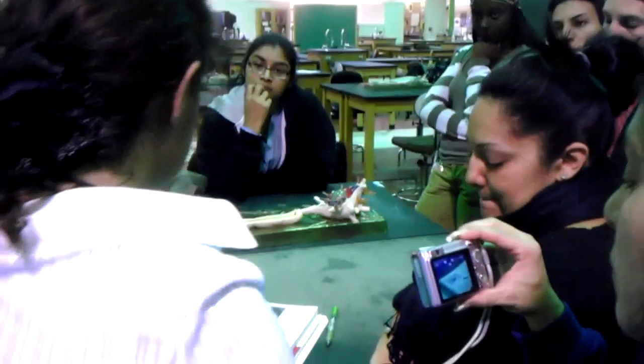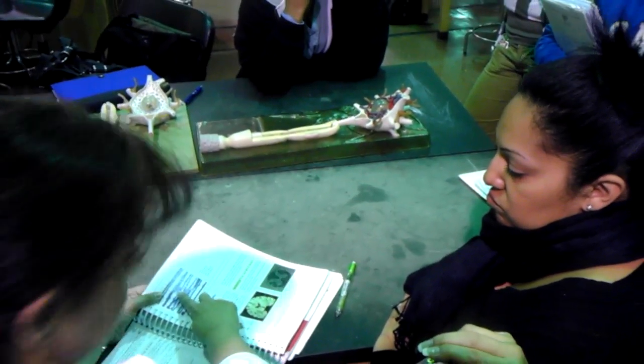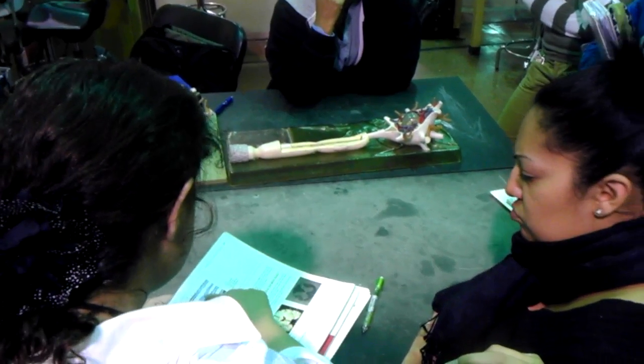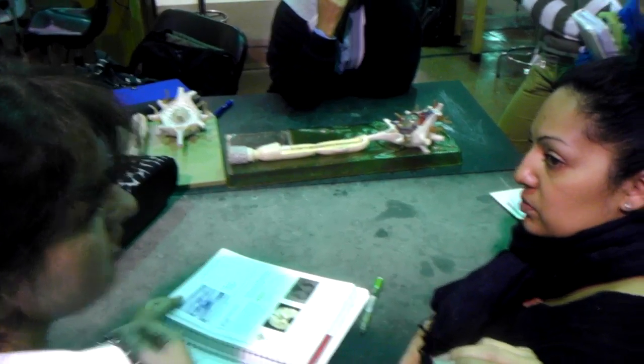If we have it for the test, I will find it and show you next session. This is the longitudinal section of the nerve. The dark thing in the center is the axon. The white thing around it is the myelin sheath, and this is the membrane of the axon, which is called axolemma.